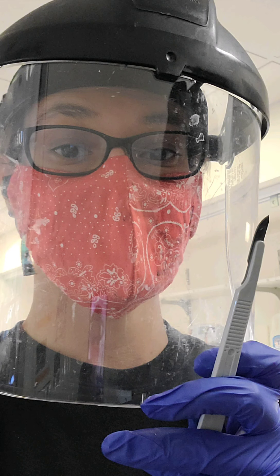In this case, the PCR worked beautifully, and so we need to extract five of these bands — which I pointed out here — and we're going to sequence them. Because UV light is dangerous to the human eye, I have to look ridiculous wearing this and use a scalpel to literally cut out the bands. I'll then put them into tubes and walk you through a gel extraction procedure.